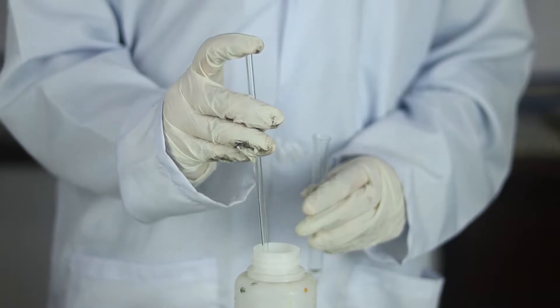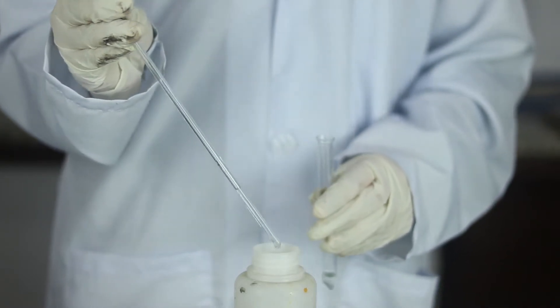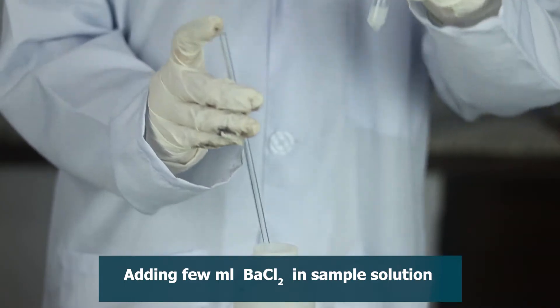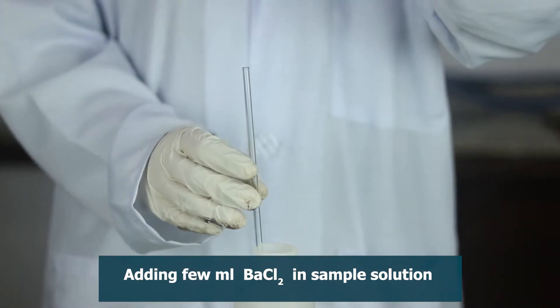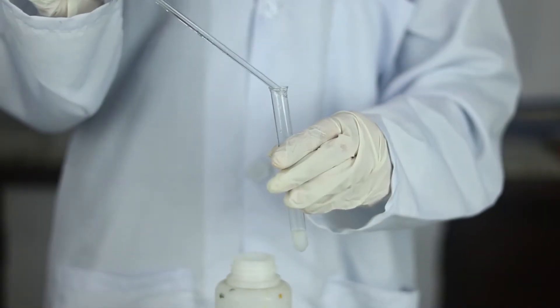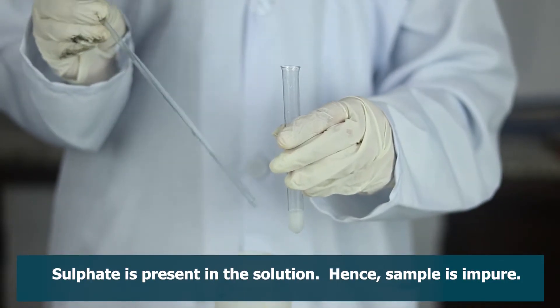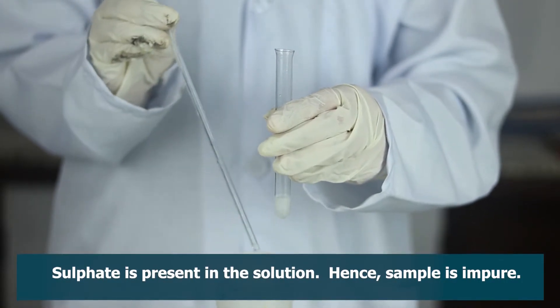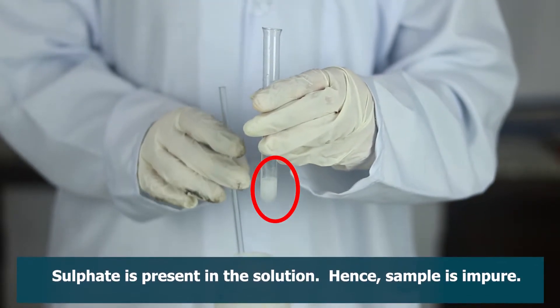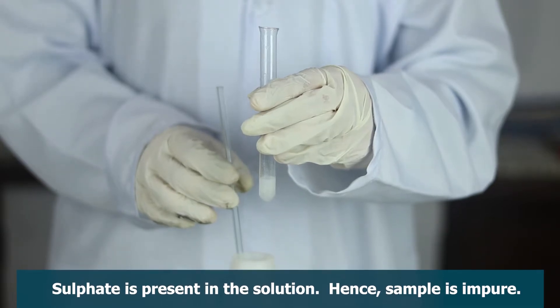Again, take a few ml of the sample solution in a test tube and add a few drops of barium chloride solution. The presence of white precipitate proved that sulphate is present in the given solution. So, the given water sample is impure.